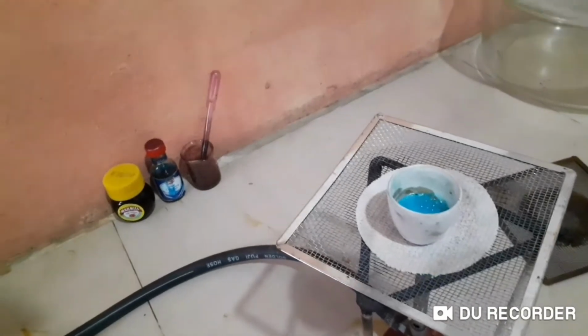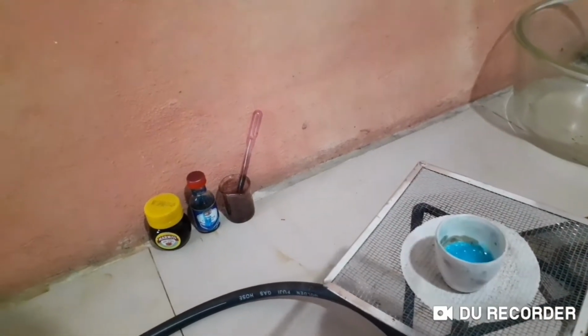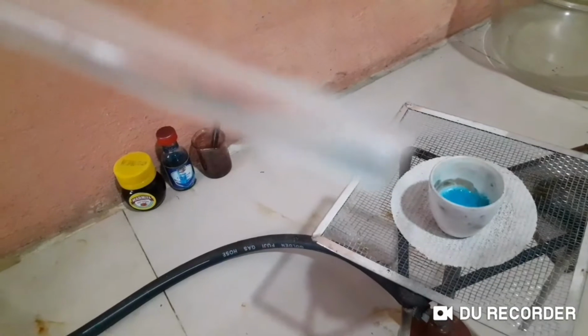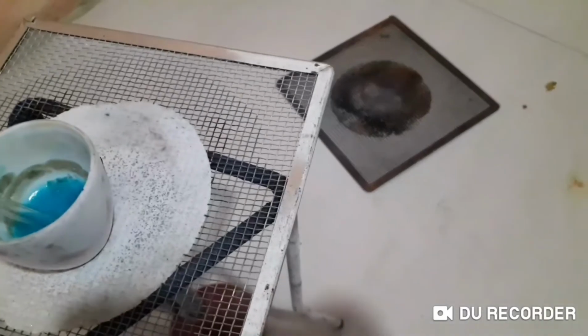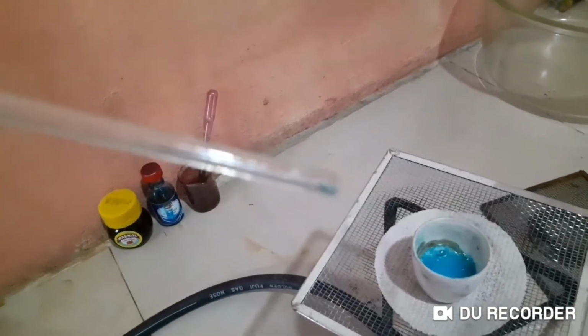No crystals as I see here. How can we know if it's crystals? You will see small crystals. There are no crystals here. It's not crystallized yet. It has not reached the saturation point still. If it has reached the saturation point, you will see some crystals on this.